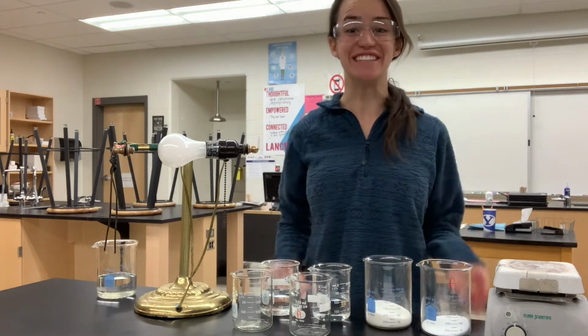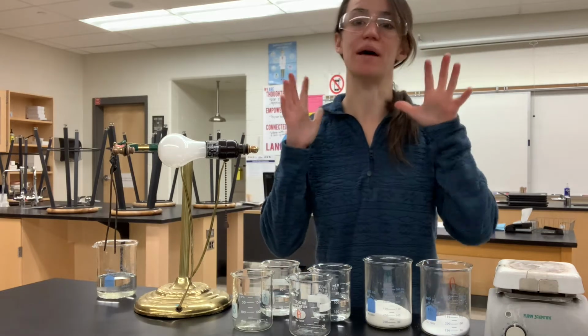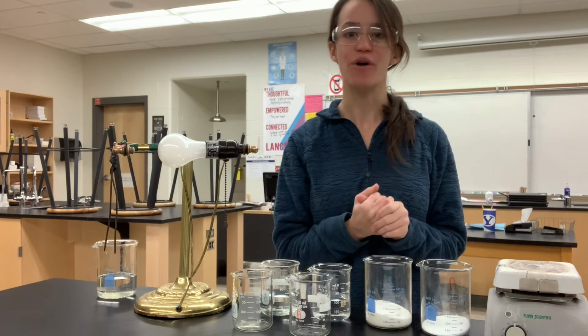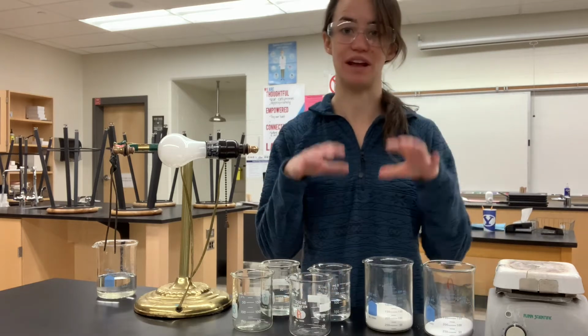Alright class, today is a really exciting day because we're doing a lab, and even though you aren't able to be in class, I'm going to do the lab for you and you can finish the work. And hopefully this will be something that you find interesting and fun even though you can't actually do it hands-on.